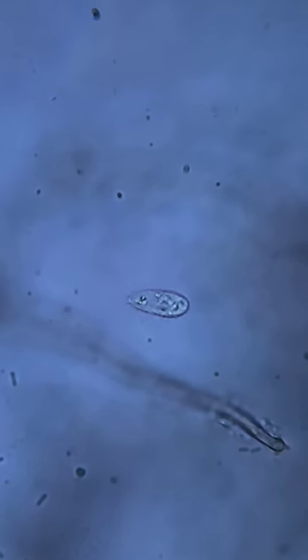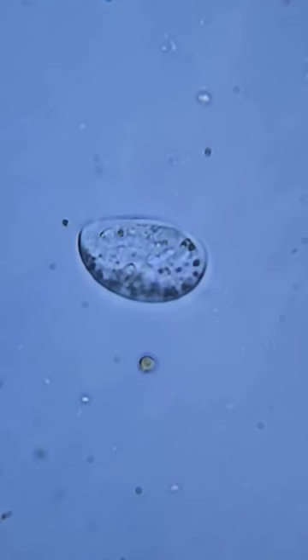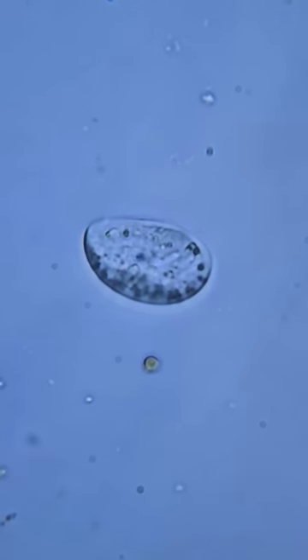There's this little guy just hanging out relaxing, till this big bruiser came by and pushed him out of the way. This ciliate here looks like it's pulling food into itself. Tons of bacteria in here too.